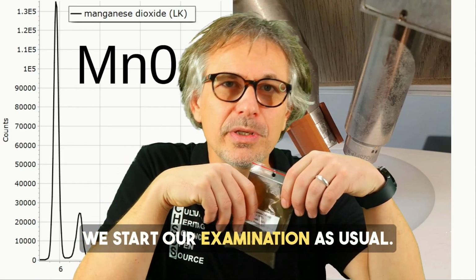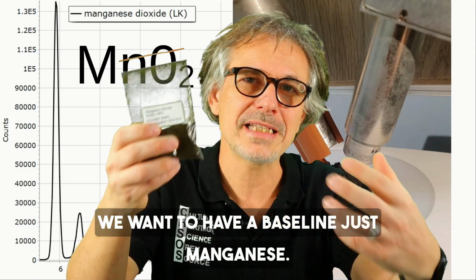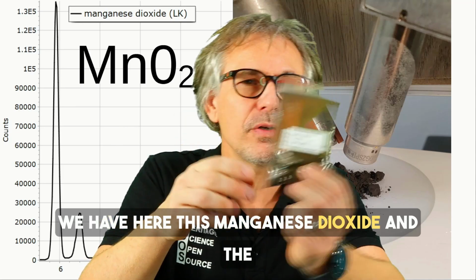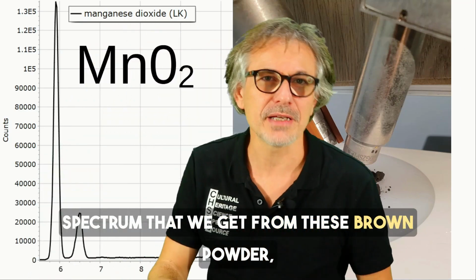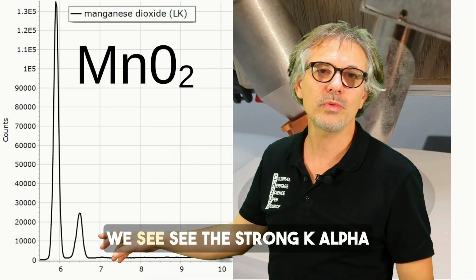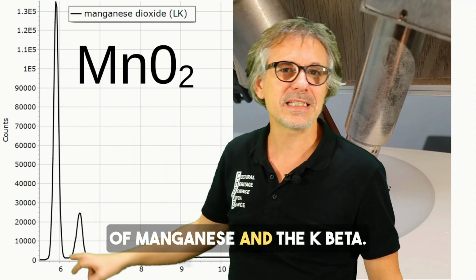We start our examination. As usual, we want to have a baseline, just manganese. We have here this manganese dioxide, and the spectrum that we get from this brown powder, the base for umber, is this one. We see the strong K alpha of manganese and the K beta.